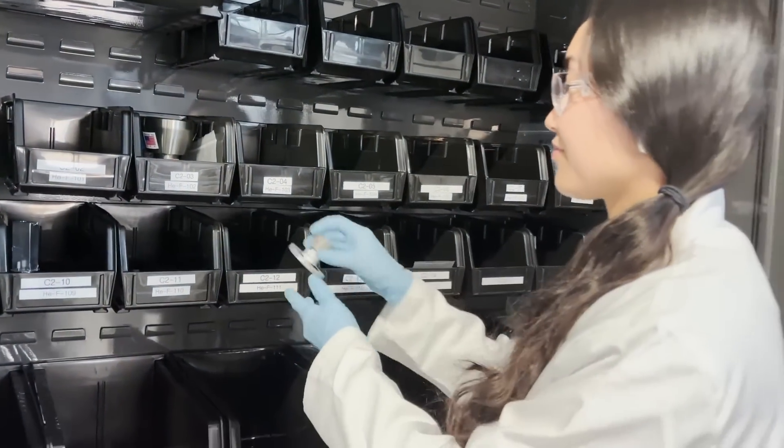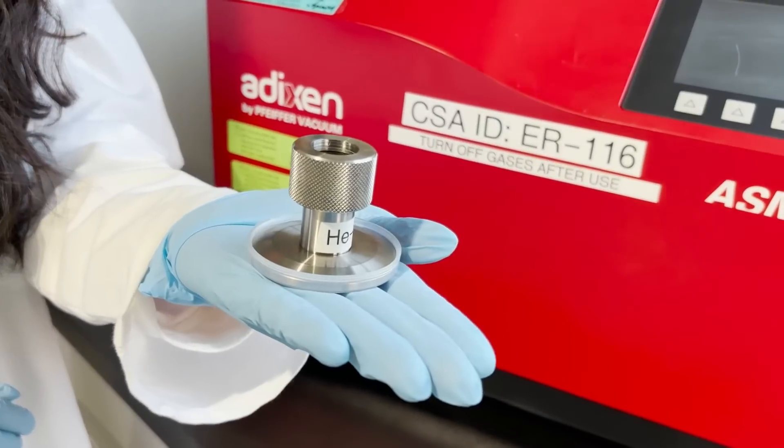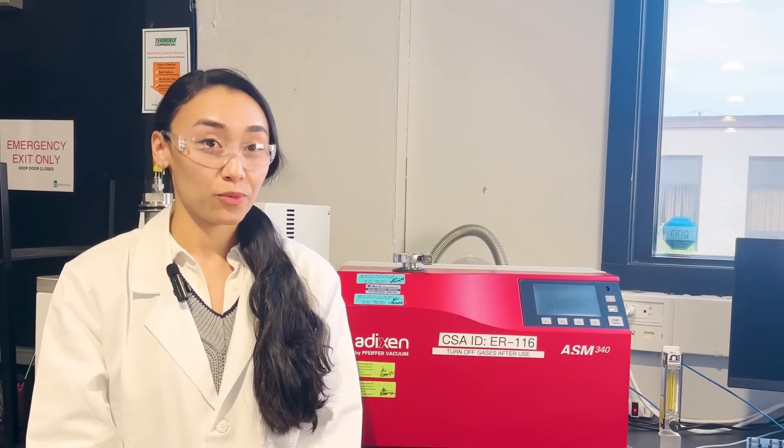Considerable published research exists exploring rigid package leaks and the relationship to risk of leakage and microbial ingress. According to USP Chapter 1207, the maximum allowable leakage limit of less than 6×10⁻⁶ millibar liters per second can be adopted as the probability of microbial ingress, which was predetermined to be less than 0.1.